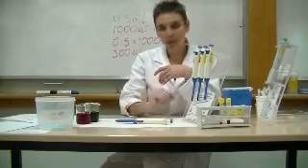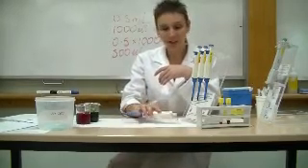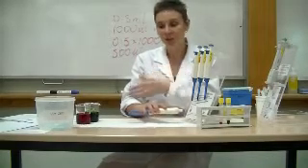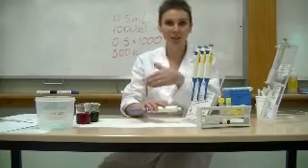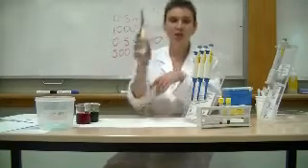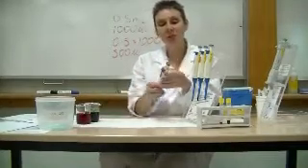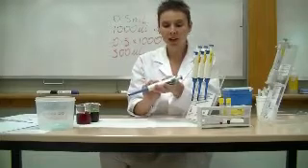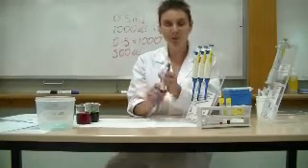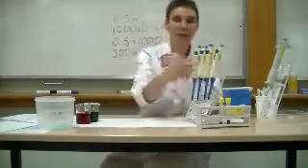Don't lie your pipette down on the bench, especially when it has a tip attached. Partly the tip will then not be sterile, and also if there is fluid in that tip it can go up into the body of the pipette. Certainly do not hold your pipette upside down, and be careful not to wind the plunger above the maximum or below the minimum volume set for that pipette. So, happy pipetting!